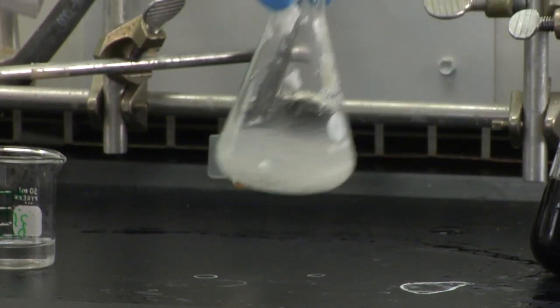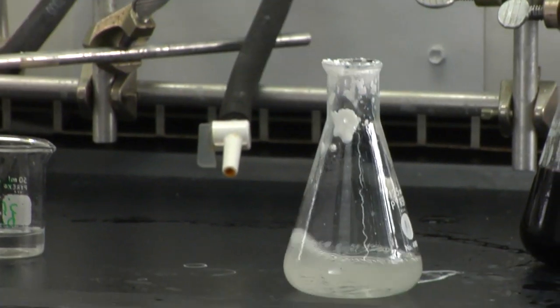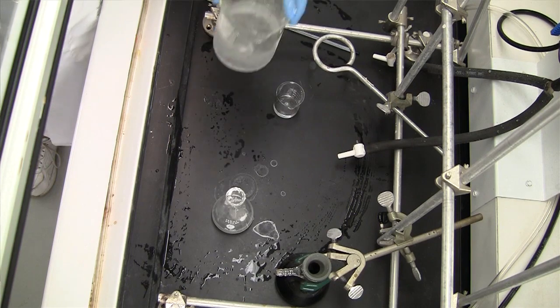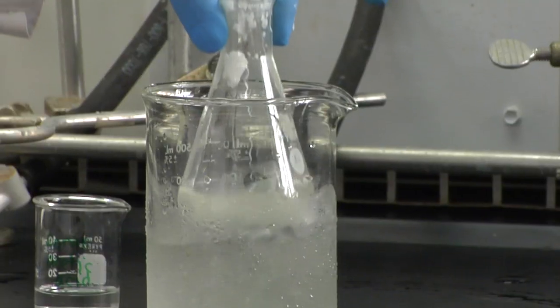We're going to allow this to dissolve. Then using an ice bath, we're going to cool the temperature down to about 15 degrees Celsius.